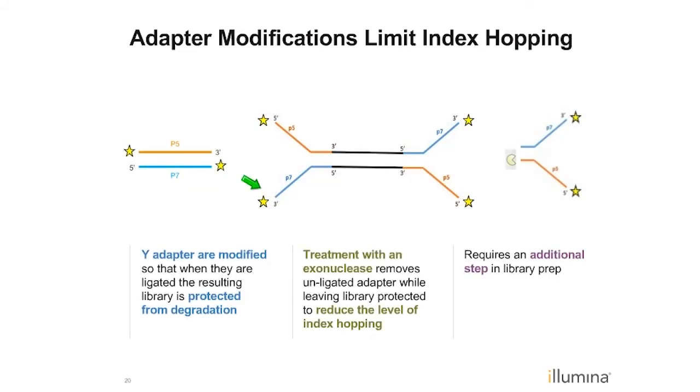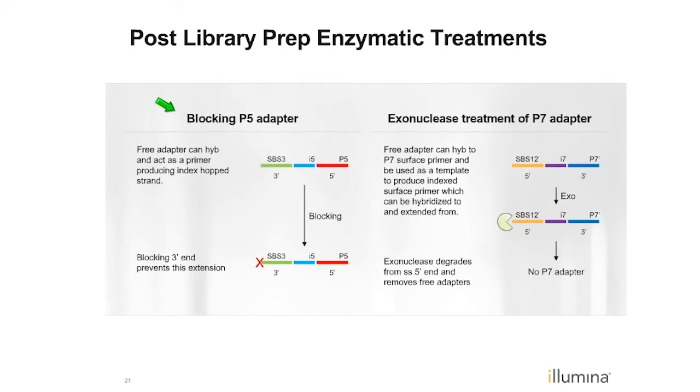The other thing that we're doing as part of these new adapters is building in specific modifications into the adapters. You can imagine that after the ligation process, these ends are exposed to solution, if you will, the 5' end of this strand and the 3' end of that strand. So what we do is we block those ends in the duplex state of the adapters, and if they are not ligated together, we can use various treatments to fix that problem. We have used, for instance, an enzymatic degradation process to chew up free adapters so that these fully ligated adapters wouldn't be affected. We've also used other types of treatments, as shown on the next slide, an enzymatic treatment that is essentially more of a blocking effect, where we block all the free 3' ends, which essentially stops a lot of this hopping from happening due to the free index.